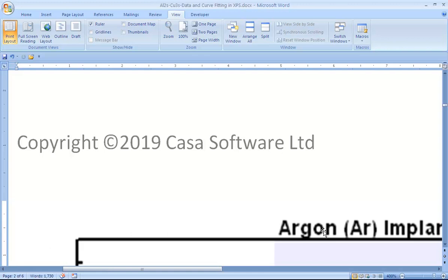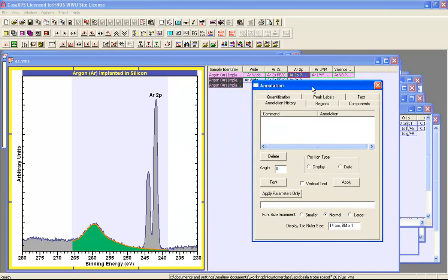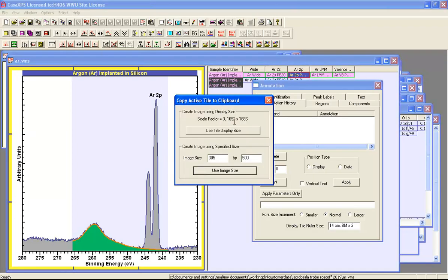So if we want to rectify this, then on the annotation history property page of the annotation dialog window, there's an option that allows us to change the resolution of the bitmap. In fact, what you do is you specify a factor. So a factor of 3, when I press return, will result in the creation of a bitmap with characteristics that are now determined by this scale factor 3. In other words, the bitmap itself has been increased in width and height by a factor of 3, but also the text and the line widths will also be adjusted by a factor of 3.